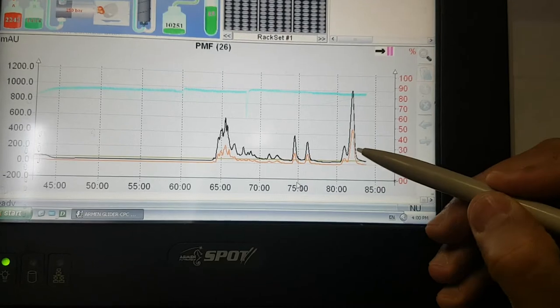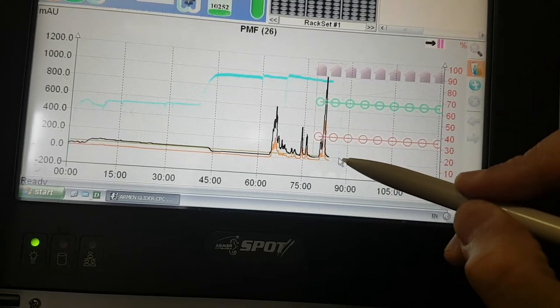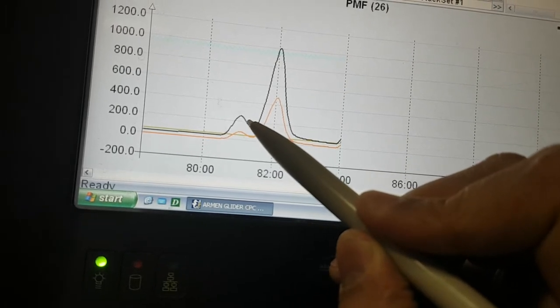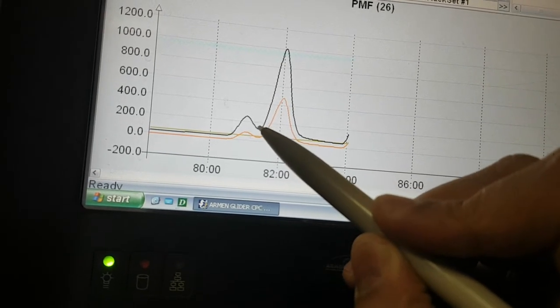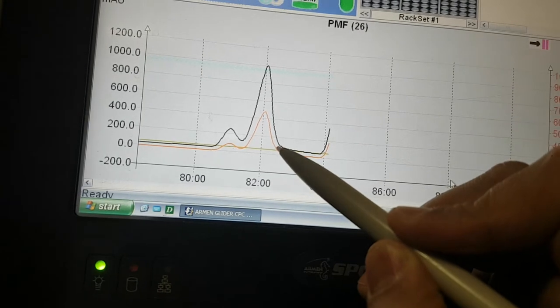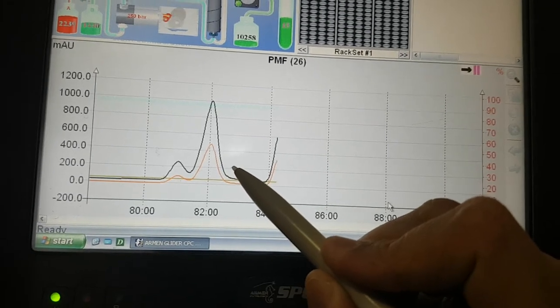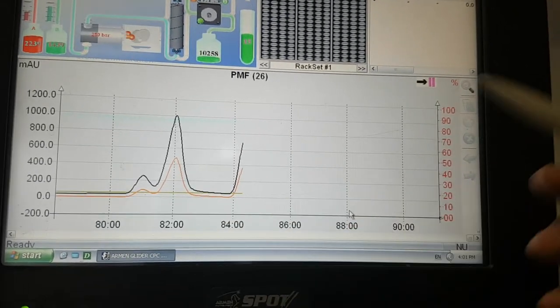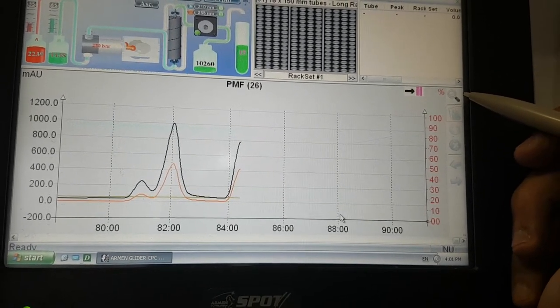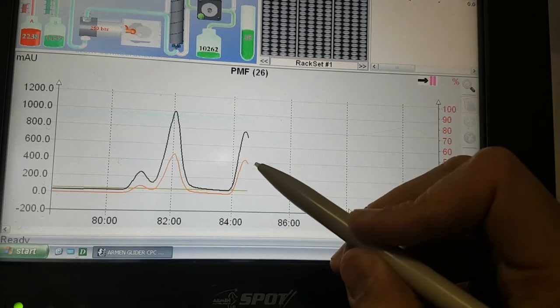Or you can, for example, here, collect from here until this point, then you will take this part to the waste from here until here, then you will collect this part from here. You will lose some amount, but you will get your compound without some further rounds if you want to stop at this point. So we are still getting our compound.